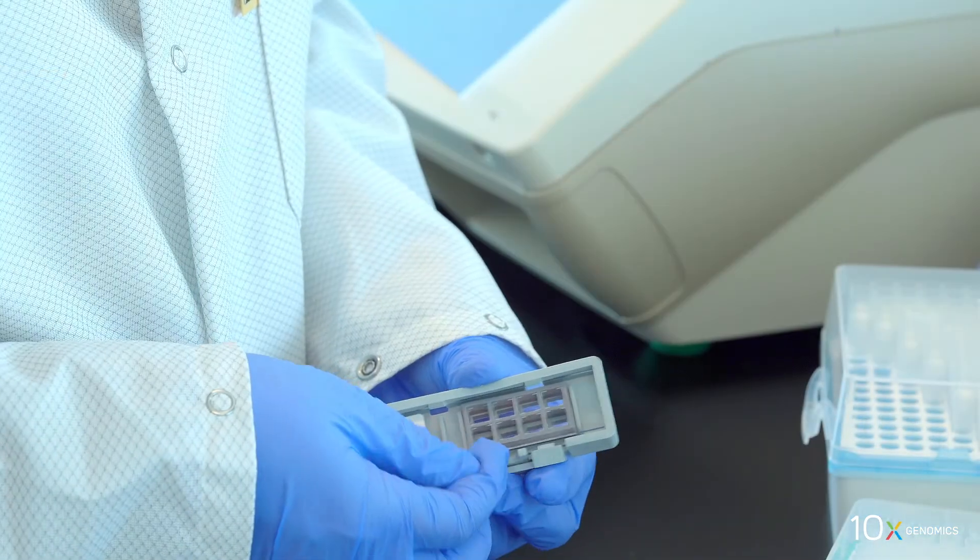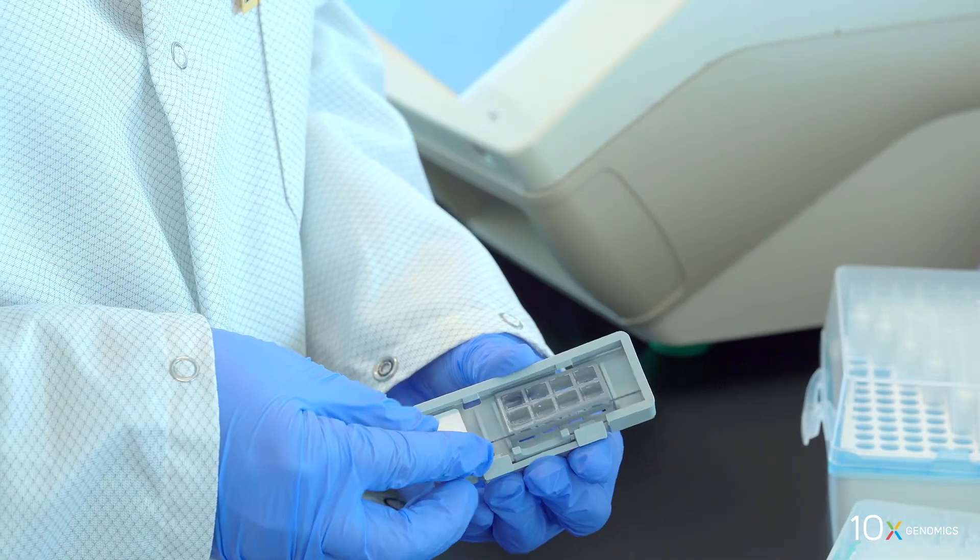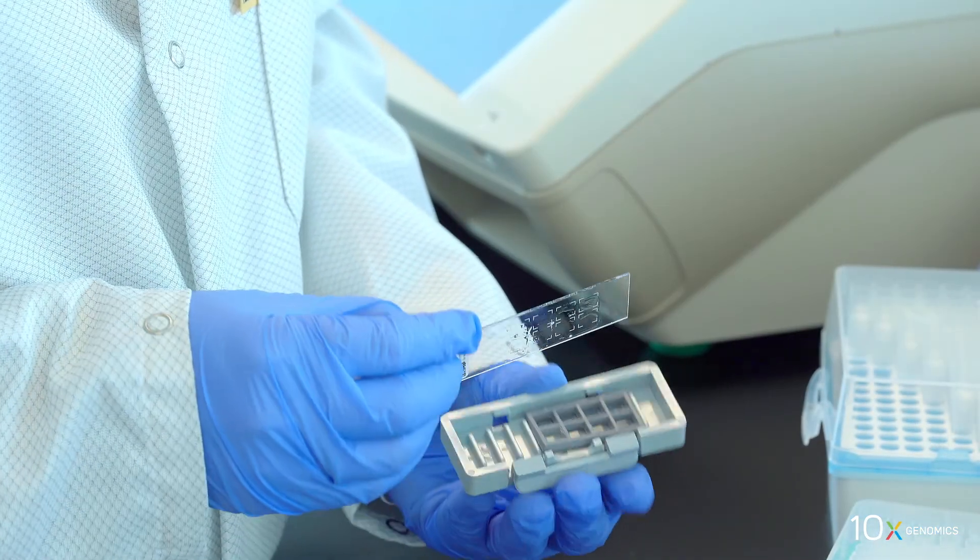We have completed cDNA synthesis. Next, we will remove the tissue from the slide.